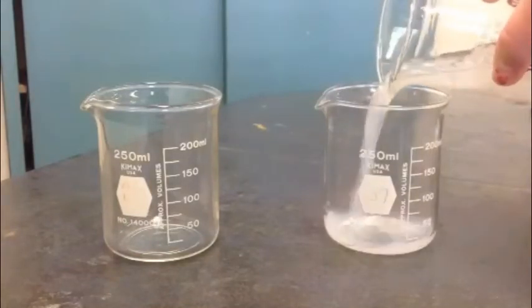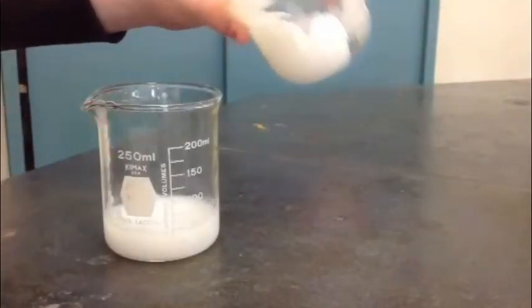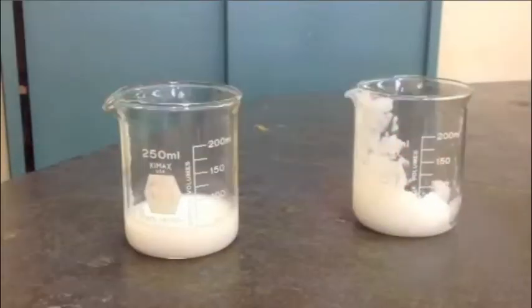Now that we have our metal hydroxide, we can explore its amphoteric properties. To do this, we must split our zinc hydroxide precipitate into two containers. To the first beaker, which now contains half of the zinc hydroxide precipitate, we will continue to add hydroxide. To the second beaker, which contains the other half of the zinc hydroxide precipitate, we will add hydrochloric acid. First, let's see what happens when we react zinc hydroxide with sodium hydroxide.